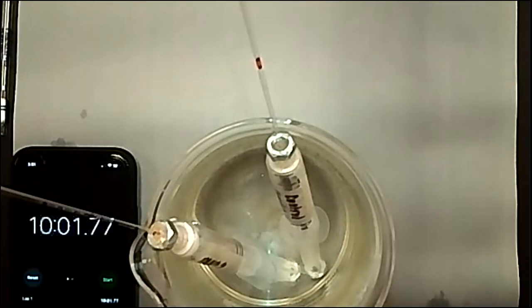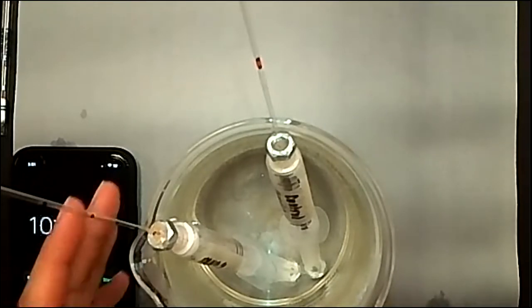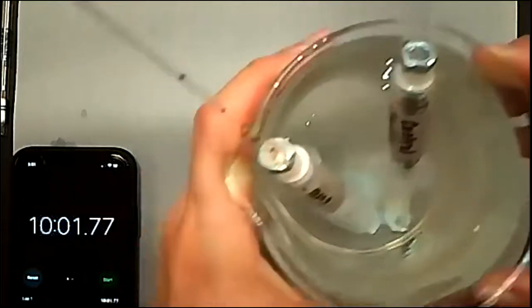So now we are going to actually collect our data that you'll be putting into your data table. So let me take out these and dry them so I can show you the distance that they have traveled. Now we don't need to worry about the actual manometer fluid anymore changing because we already have our markings. They are going to change though, just a heads up by the time I show you, because the room temperature is a lot warmer than the water temperature, but the water temperature is constant unlike room temperature. So it's nice to have that.